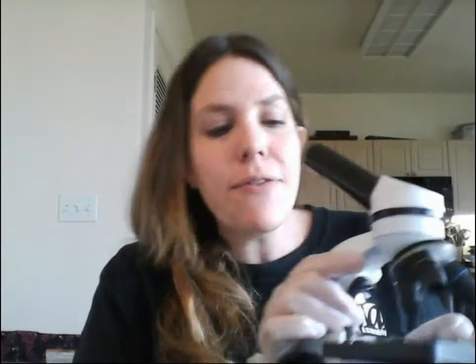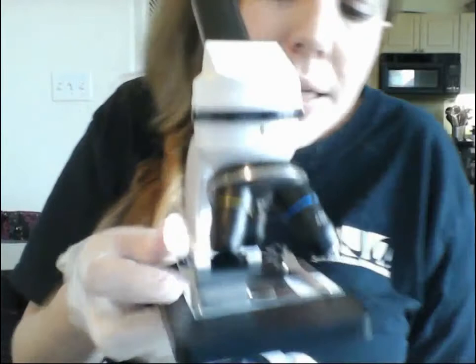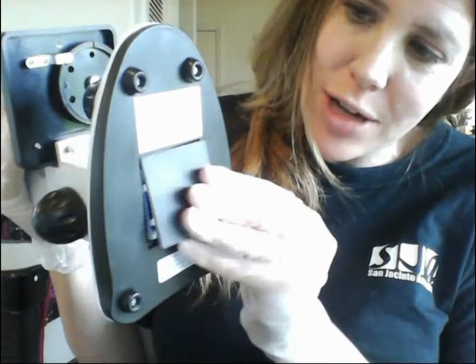Very carefully — you don't want to let the clips slam down on the glass because it'll break — slide the letter E slide onto the stage and get it centered right in the middle. Make sure you have batteries in your microscope; you're going to need three AA batteries, and make sure they're nice and fresh.